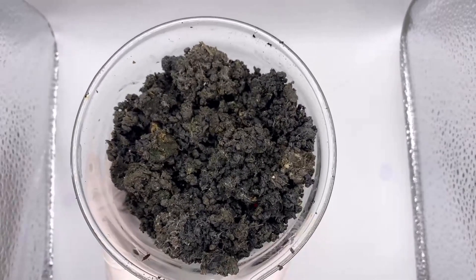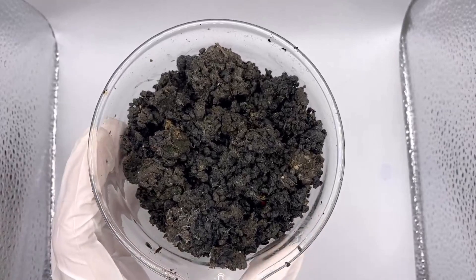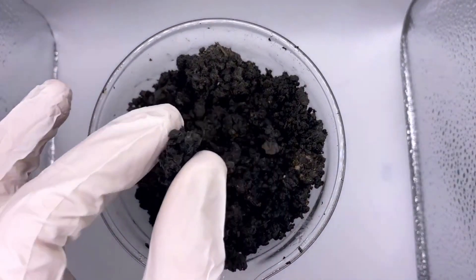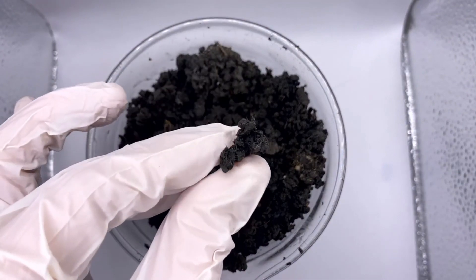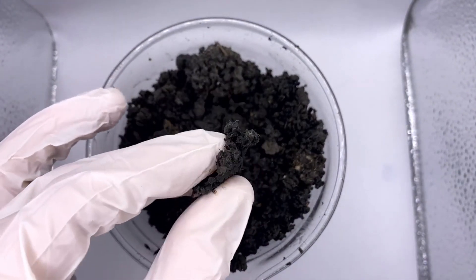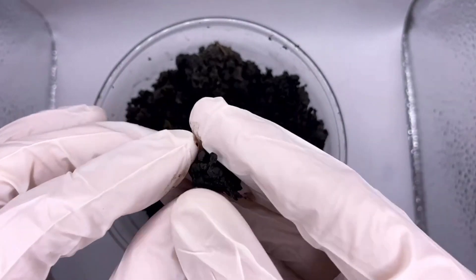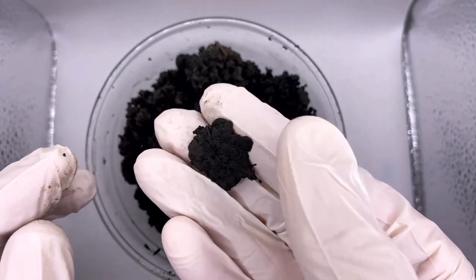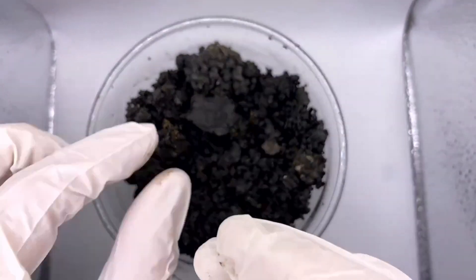In preparation for the trial we calibrated the feed screw using a sample of the received sludge. What we found in this case was that the sludge supply varied a lot in its moisture content, so our initial calibration was not reliable across the duration of the trial.